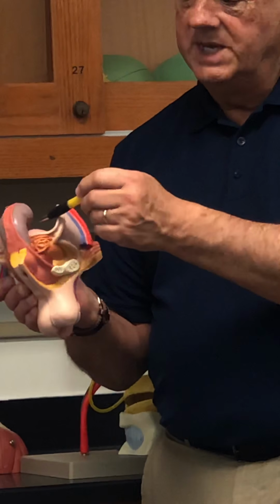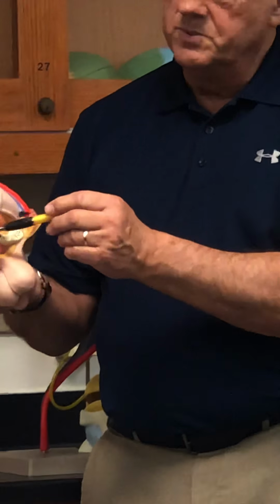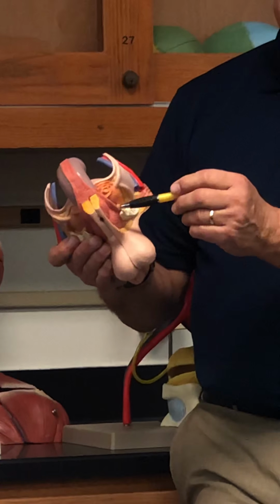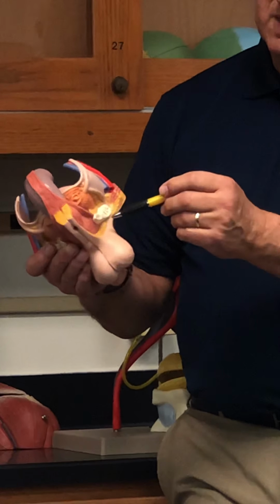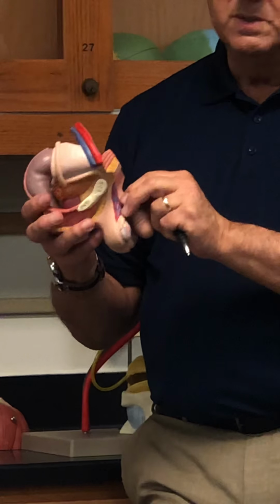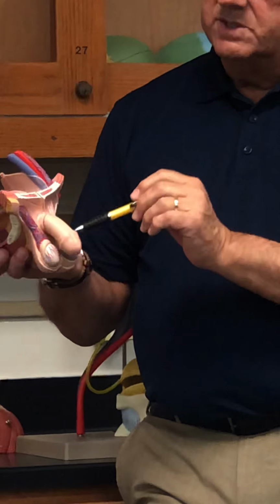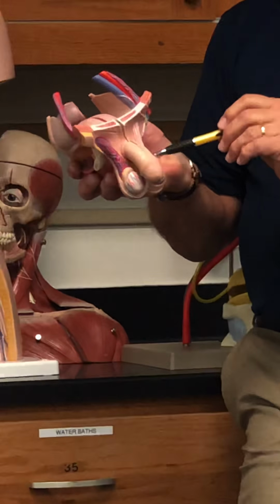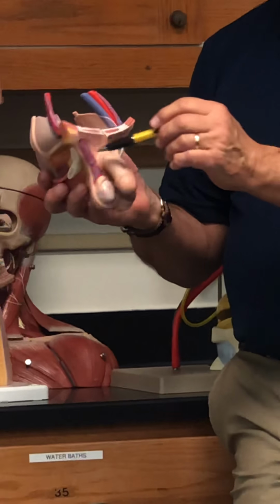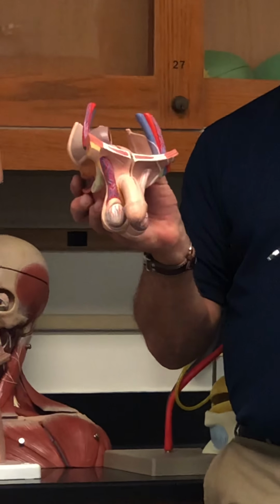Again, it's just below the bladder. That's the prostate. It has to make its way through the prostate, and then the prostatic urethra, right, and then eventually make its way through the penis, which is the spongy urethra at this point. Okay. Also, you can see blood vessels, right? These are the testicular arteries, and on the other side we have this unusual looking pattern of venous vessels.